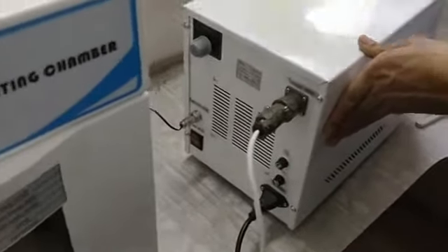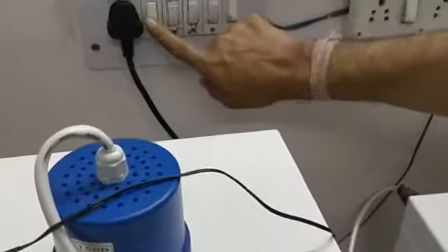This machine is at 230 volts, so I have connected the power. We have connected the power and we are going to start now. I have put the main switch on, and on the back side there is an on-off switch, this red color switch. I have put this also on.